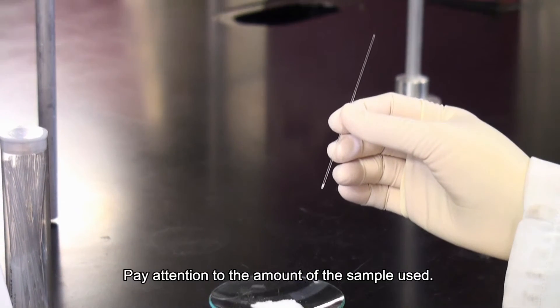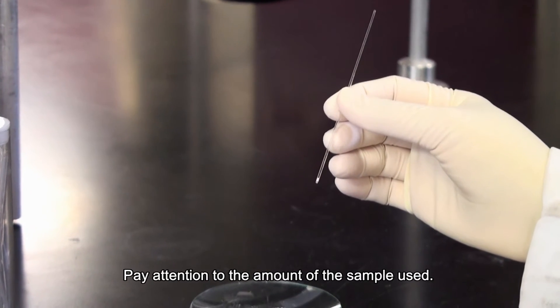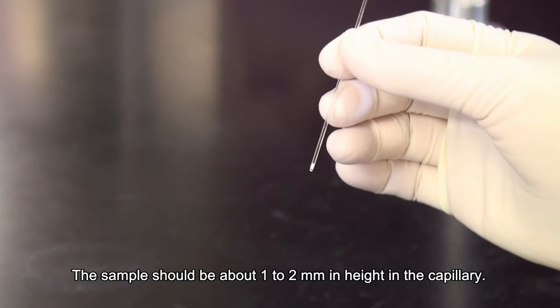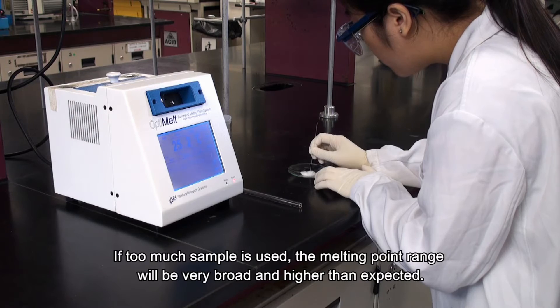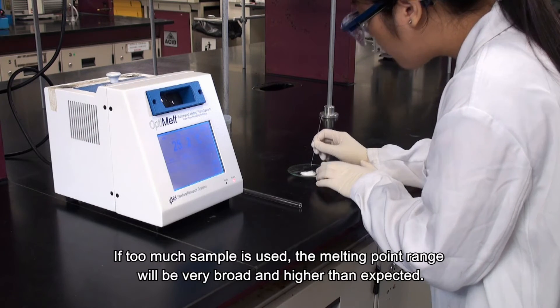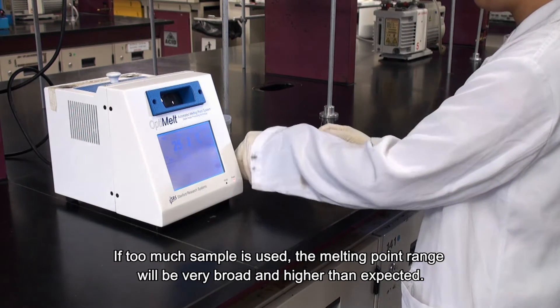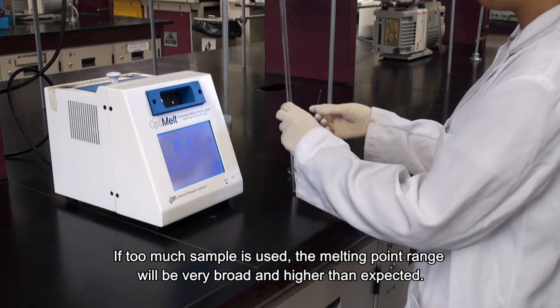Pay attention to the amount of sample used. The sample should be about 1 to 2 mm in height in the capillary. If too much sample is used, the melting point range will be very broad and higher than expected.